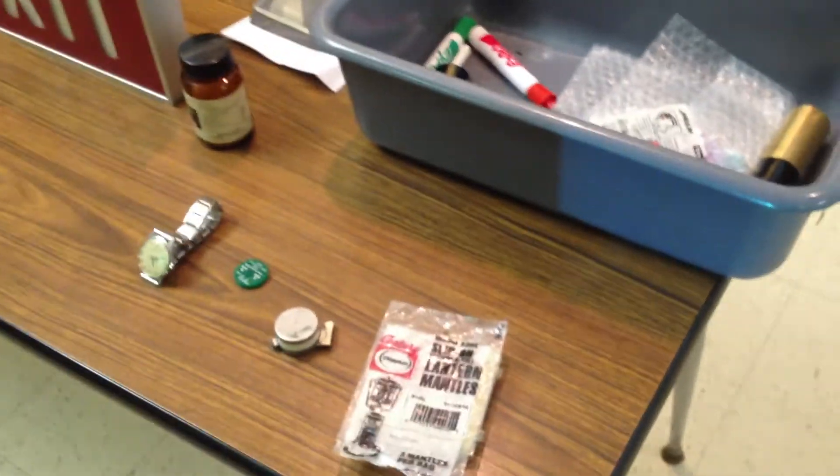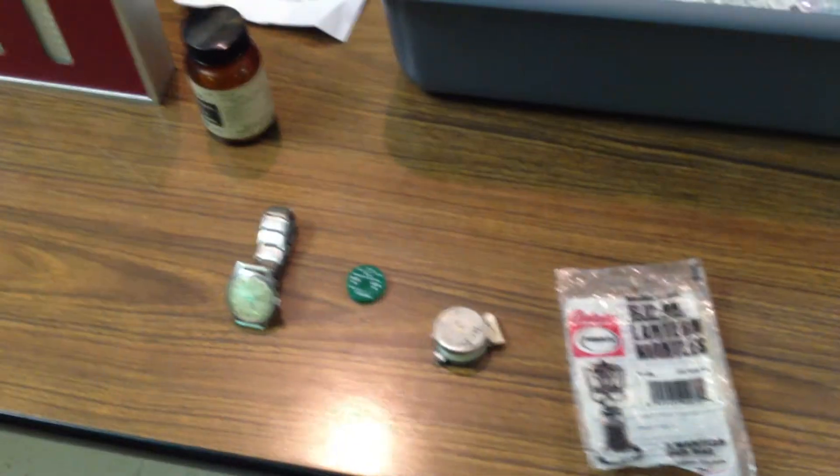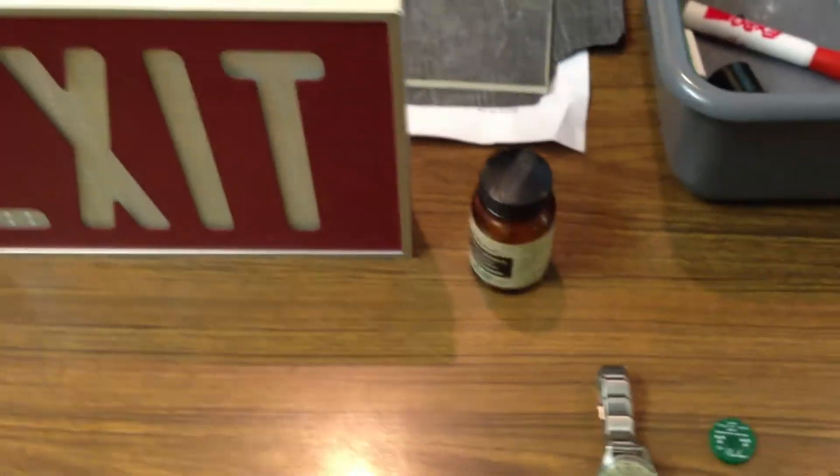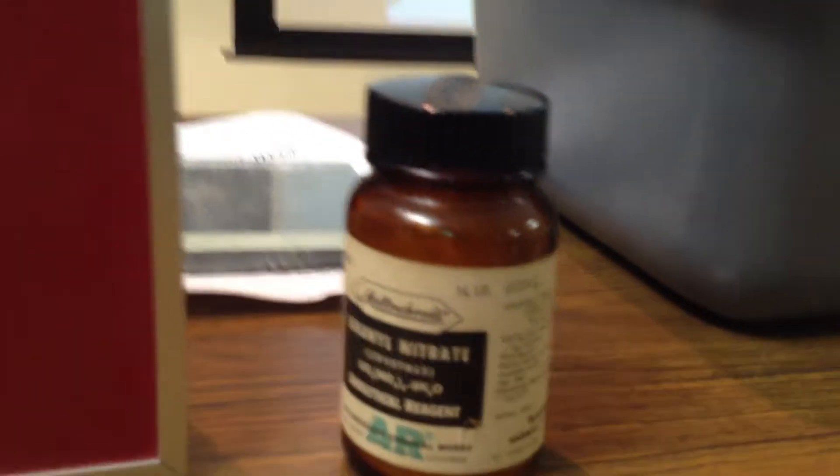Alright, so the LLE, this is LLE number two this time. It is called radioactivity, and we're going to do a series of demonstrations of radioactive sources.